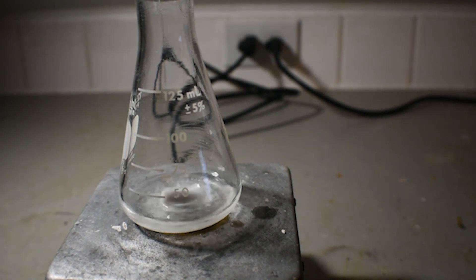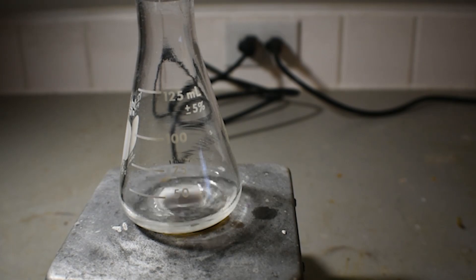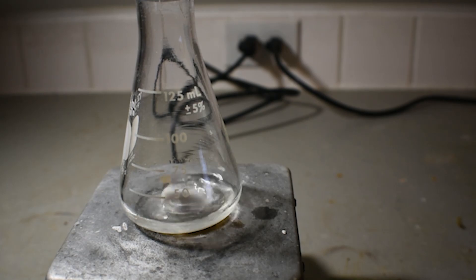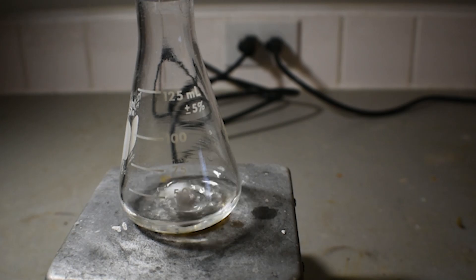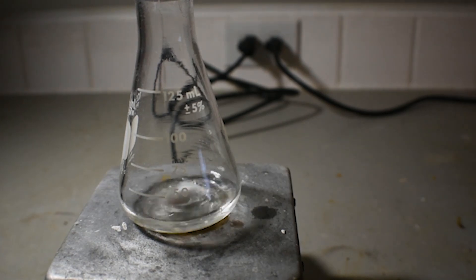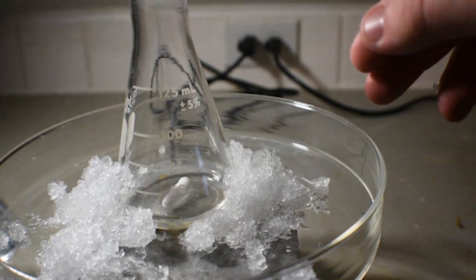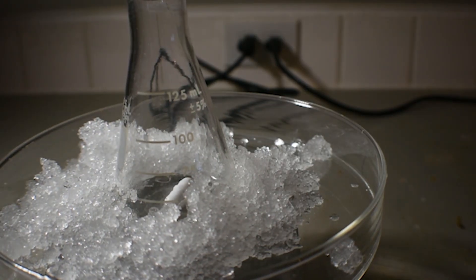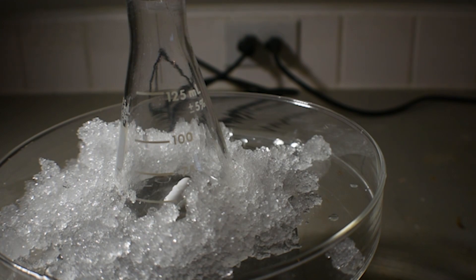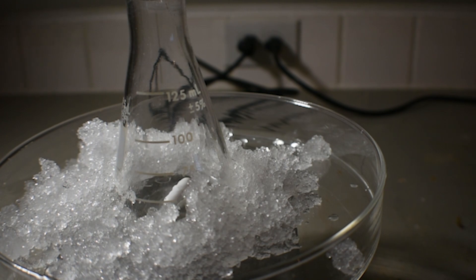While the vanillin is dissolving, I'm going to go ahead and gather some snow from outside to form a cooling bath. Now I've just got to process the snow so it's not in giant lumps. I'm going to let this solution of vanillin and ethanol cool down just a little bit, probably about 5 minutes.